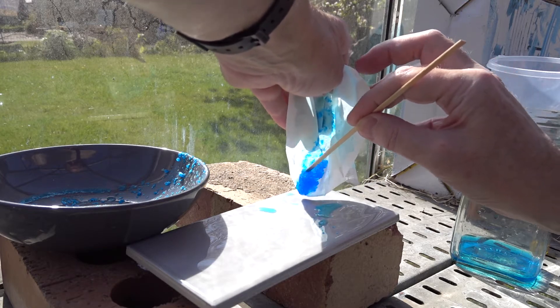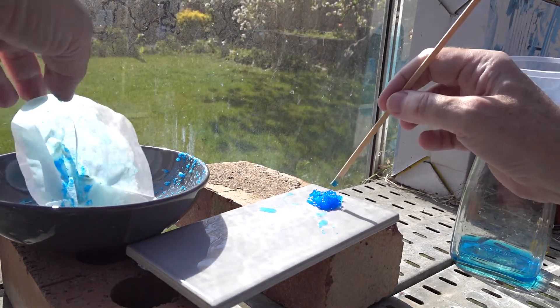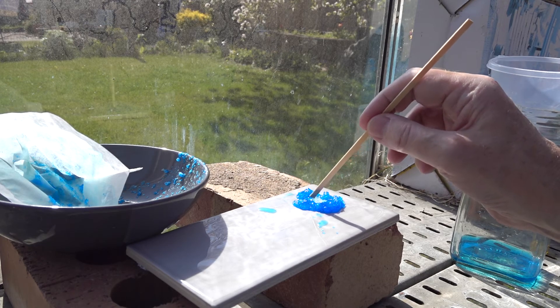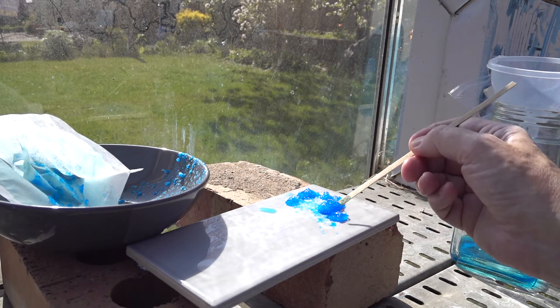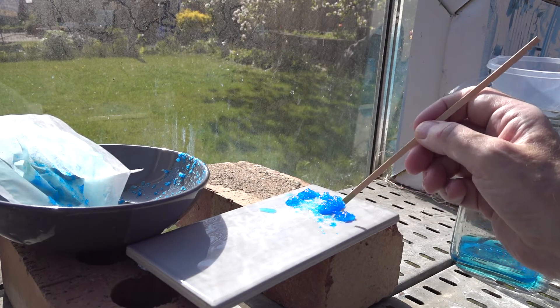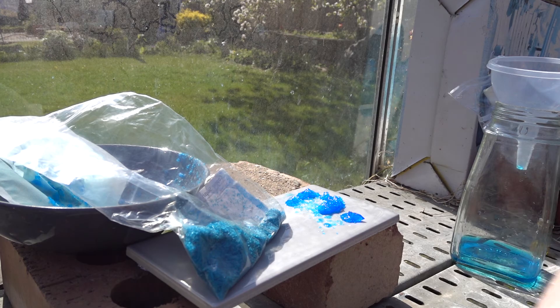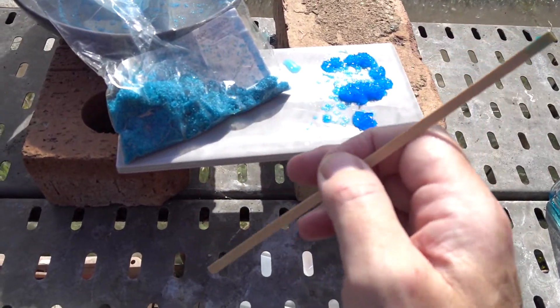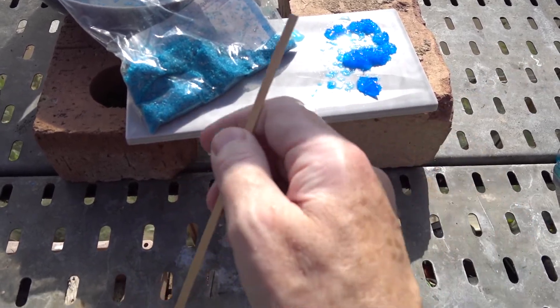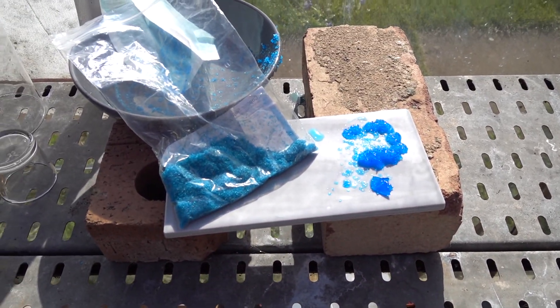There is one large crystal in here that I seeded yesterday — it's covered in smaller crystals so it's not easy to see the shape, but I could wash that. Here's the original material — quite different in colour. This is the purified material on the right: nice bright blue copper sulfate. And here's the greenish starting material from the supplier. So that's the recrystallization and purification of copper sulfate.